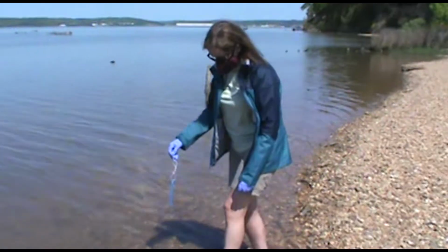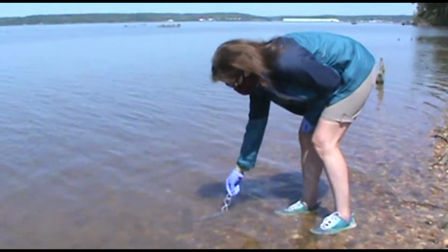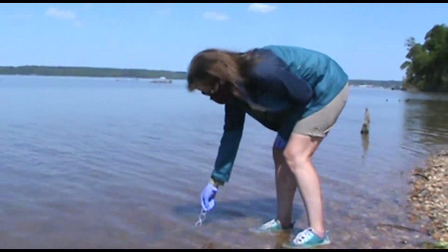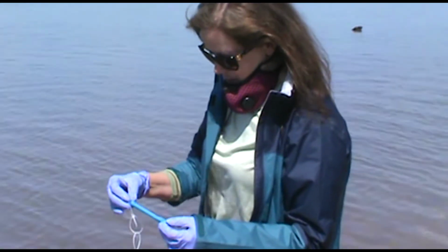Shallow, right on the edge, just a couple of inches in, and then you can lay it down. Usually it takes 2 or 3 minutes. There's where my glasses would come in handy. That's 10.5.